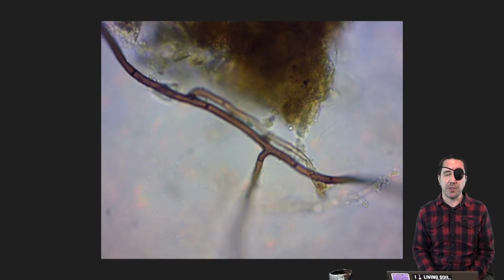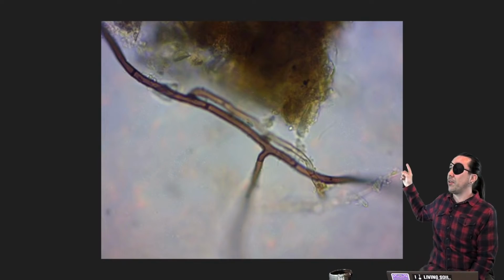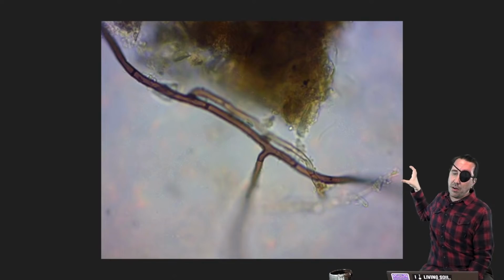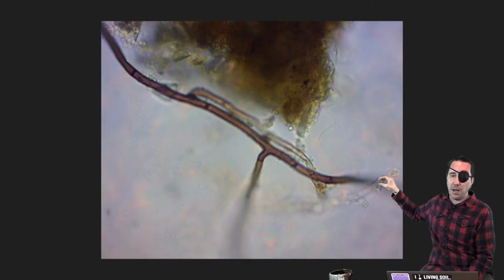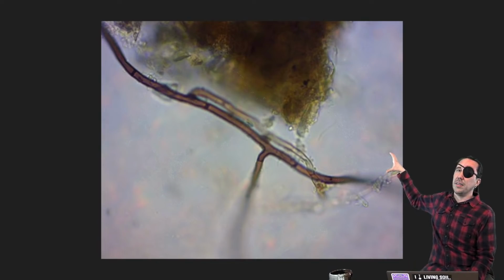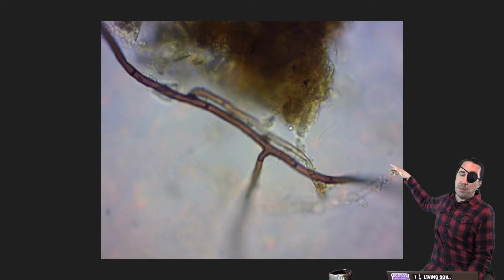So here we've got a good fungal strand. When you're looking through a sample, you're going to see roots, plant matter, fungi, and different things. The best way to determine if you've got a fungal strand is that you're going to have uniform diameter throughout the entire strand, or at least for the majority of it. If you've got some parts that are just starting to grow, they're also going to be uniform in diameter. They may be smaller in diameter, but they're going to be uniform. They're not going to go from larger to smaller or anything like that. Generally, a root or root hairs are going to have a shape that's going to decrease in size. So you want to have uniform width.